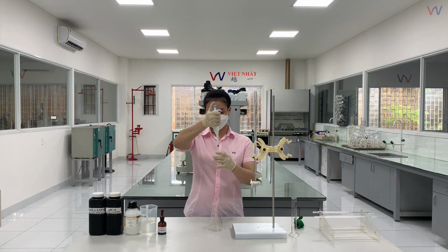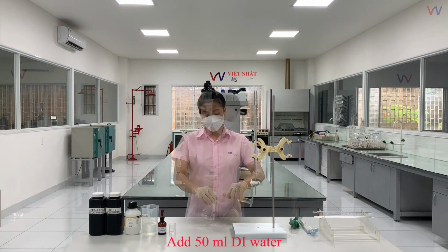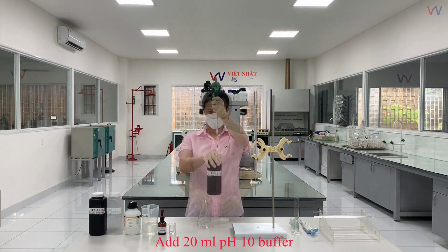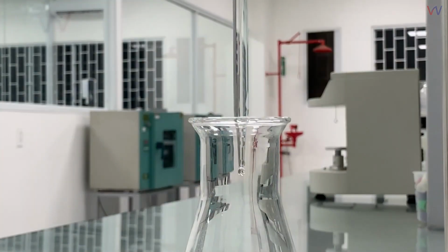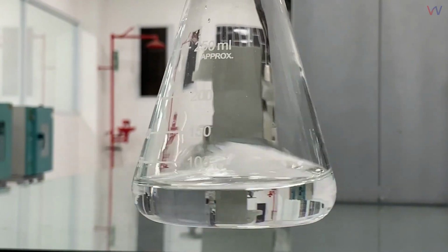We use the micropipette to draw 1 ml of the sample into the Erlenmeyer flask. Next, add 50 ml of distilled water. Shake the solution well. Add 20 ml of pH 10 buffer solution. Since the pH 10 buffer has a strong odor, perform this step within a fume hood.